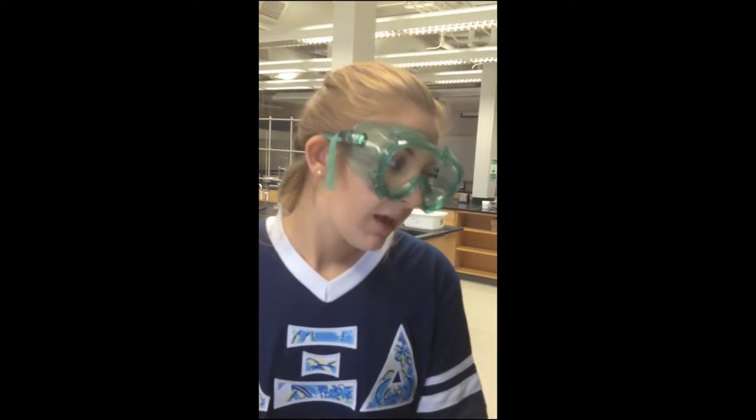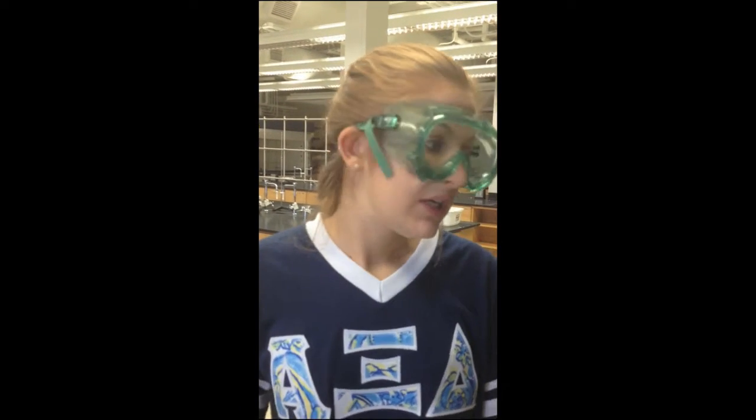As you notice, we use the same scale for all our measurements. It's important that you use the same scale. It can lead to possible error in our experiment if you don't, because each scale weighs slightly different.